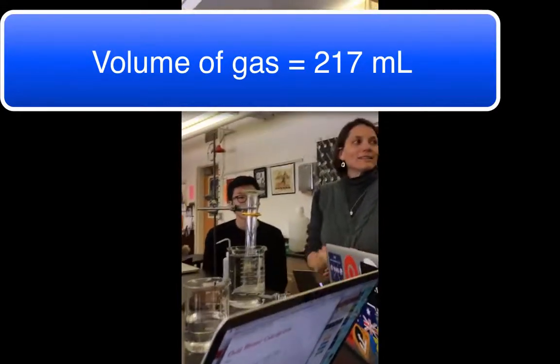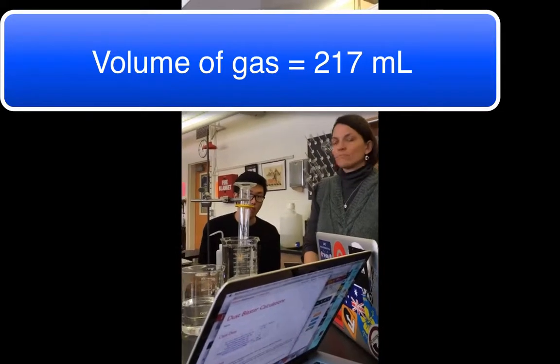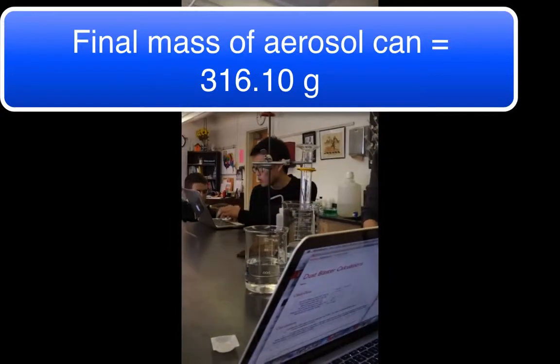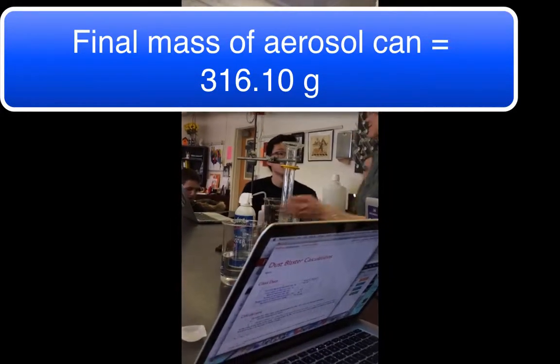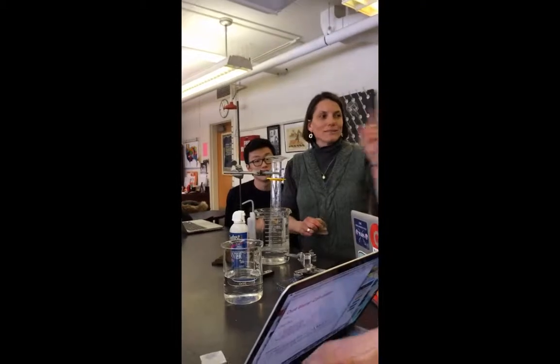Okay. Final mass of our can: 316.10. Did it go down? Yeah, it went down a lot. It should have gone down. It went down like 0.7. That's our biggest source of error right there, because I don't have a balance that measures to the hundredths or less.